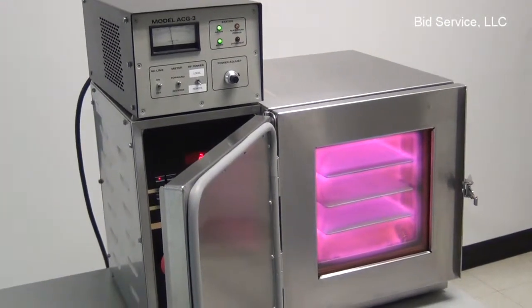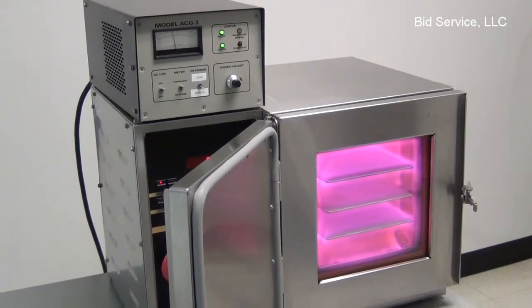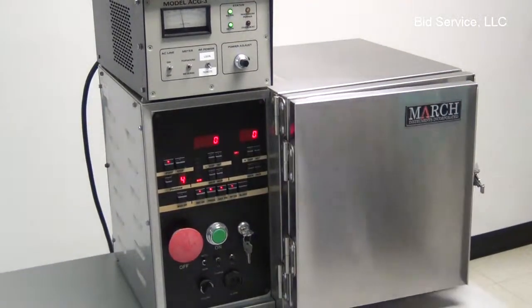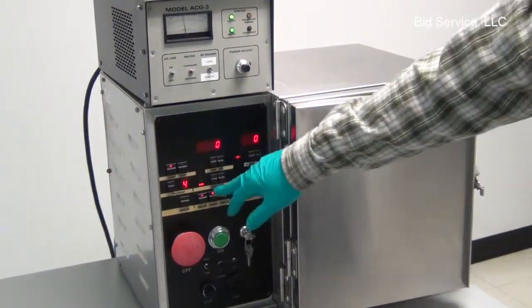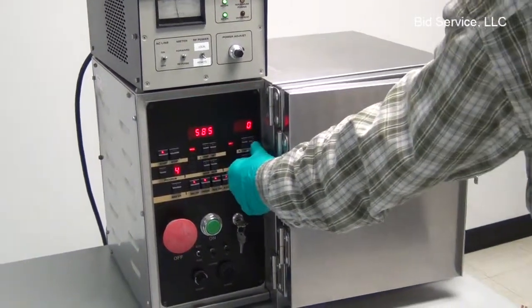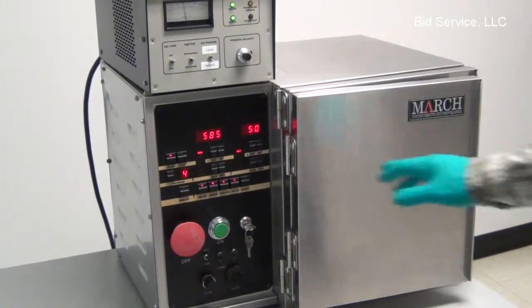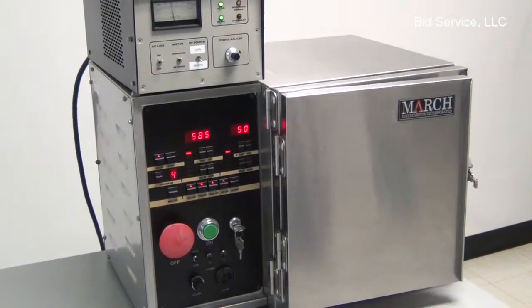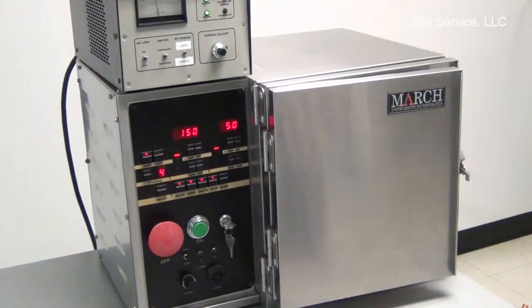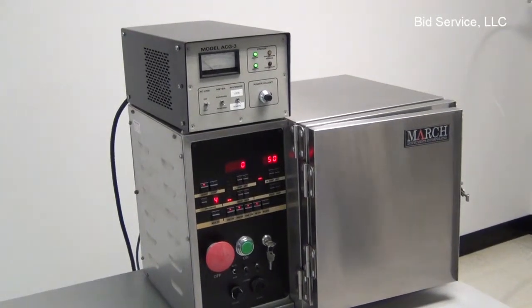Okay, now here's program 4 where we're just bringing air in. So this is an air plasma. It has a pinkish color to it. And we'll just look at our pressure. This will be channel 2 in this case, so we're doing 50% on channel 2. 50% open. The pressure is 585 millitorr. Forward power is 150, you see that on the generator. And reverse power is 0, and that's seen on the generator too.